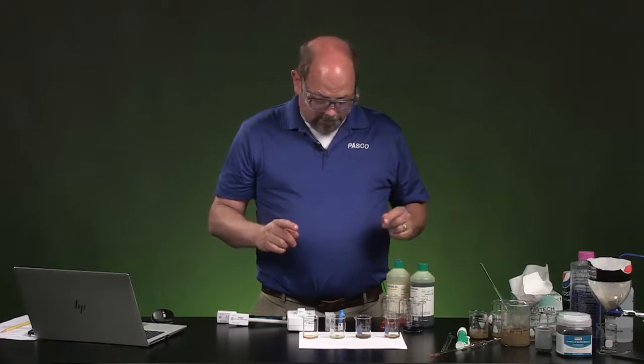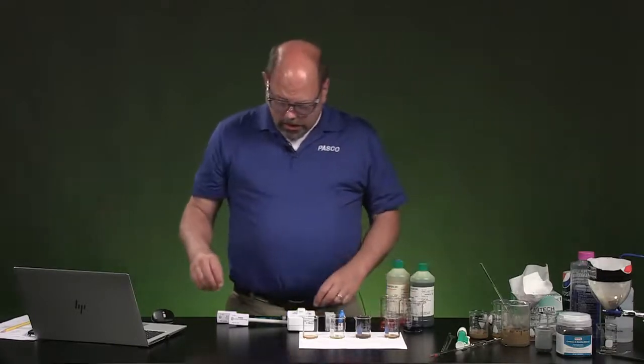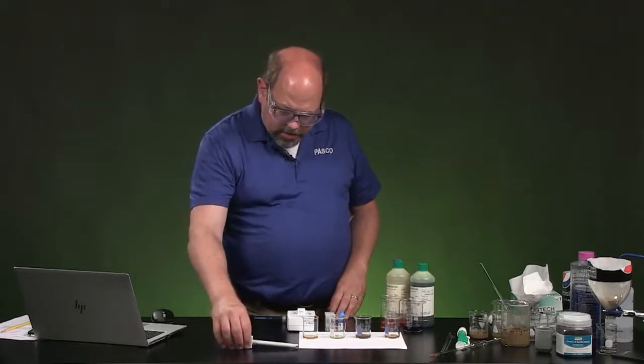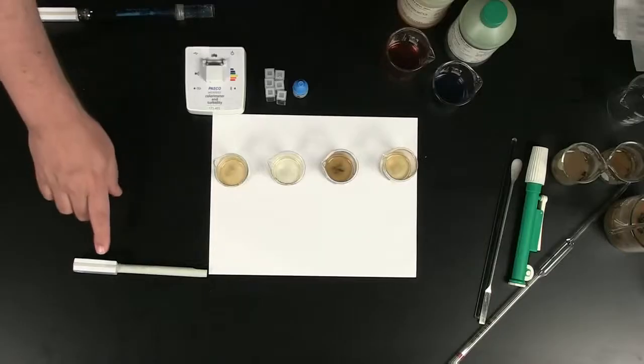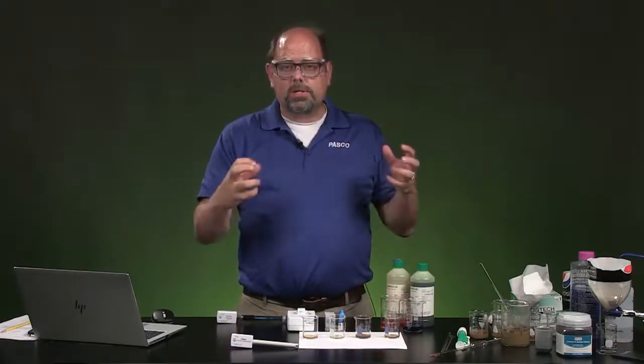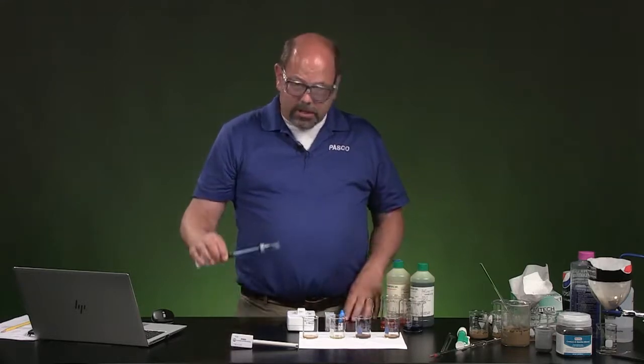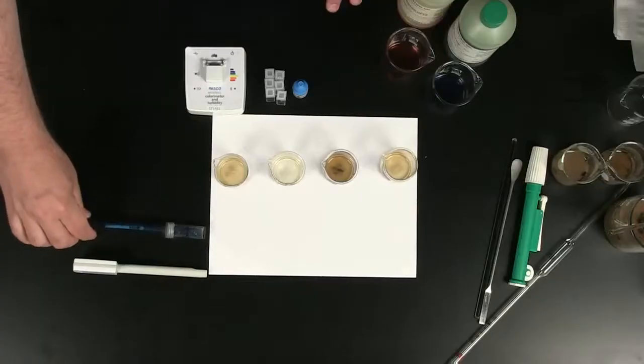Now we're going to test that. For each of these, I want to see what's made it through, and I'm going to take a systematic approach to this. I'm going to use the conductivity sensor first to see if there's still anything that could have dissolved and dissociated, like ionic salt, that made it through. And we'll see if that made it through those filters. Next, we'll check the pH, okay?